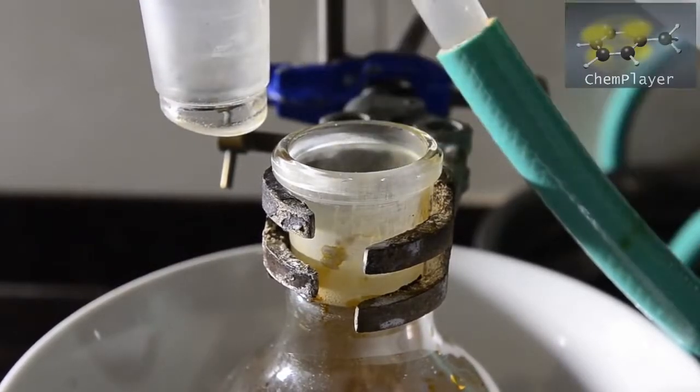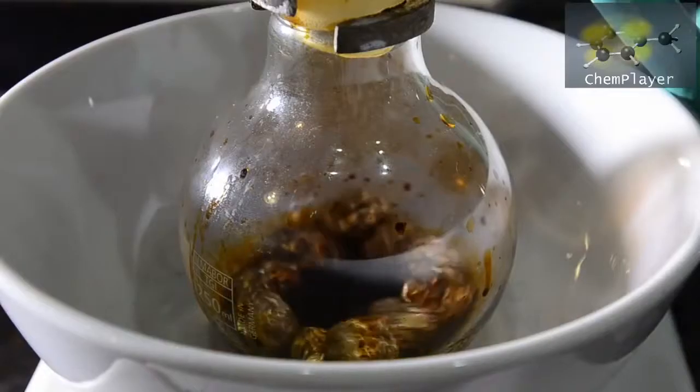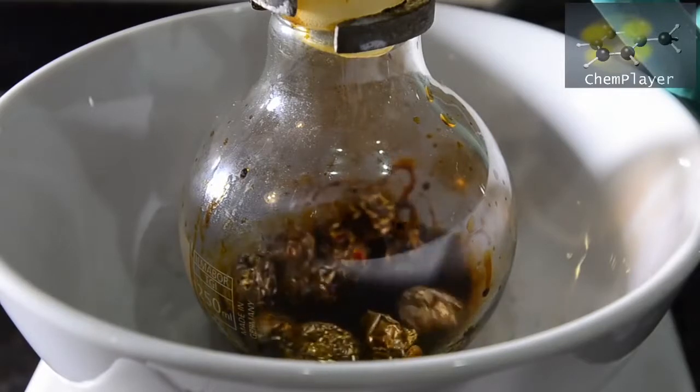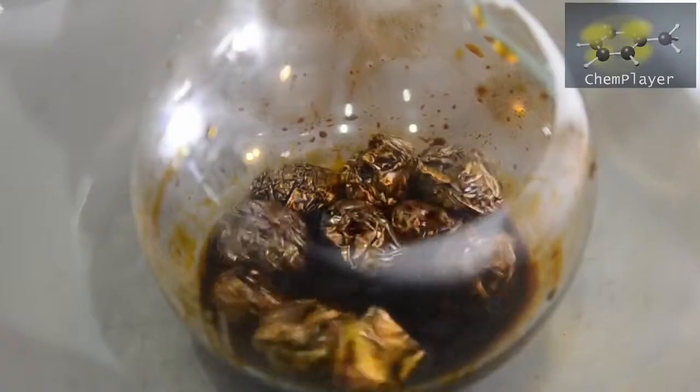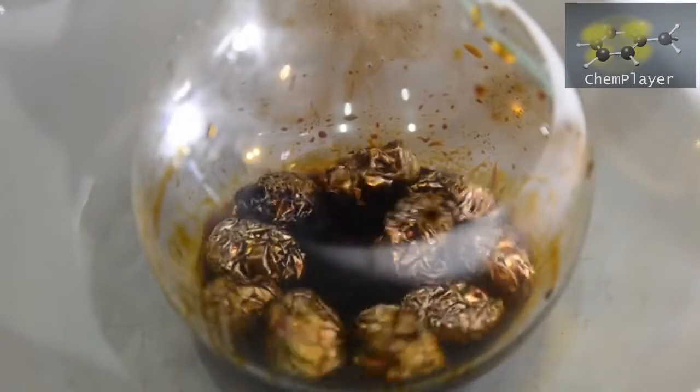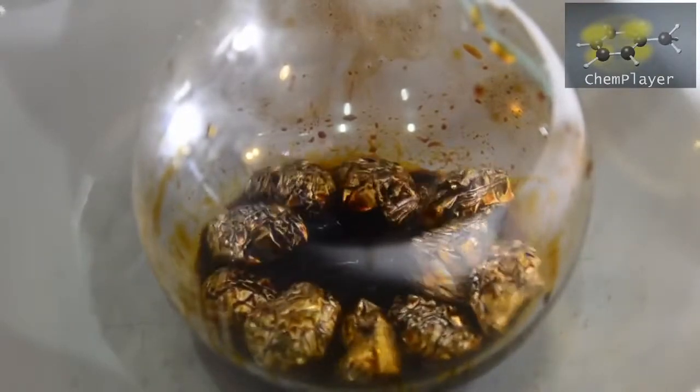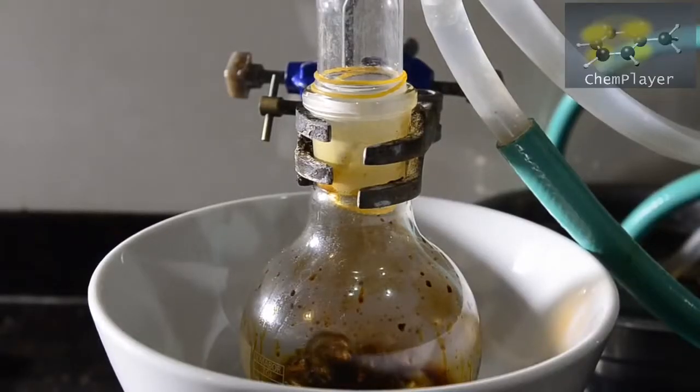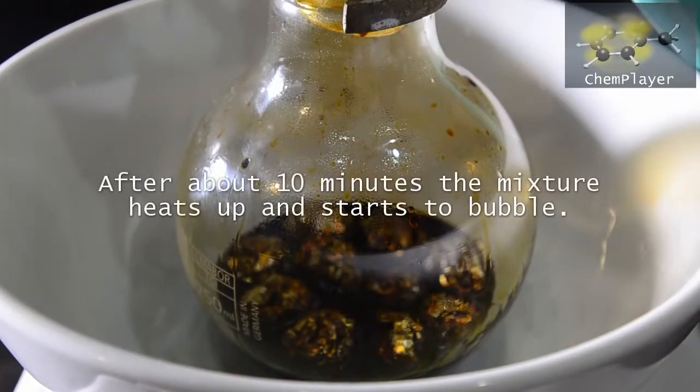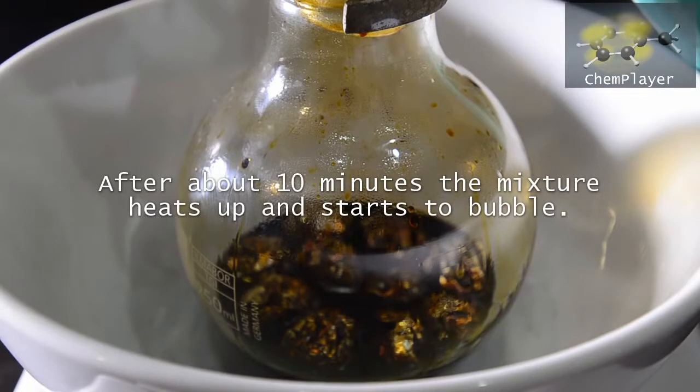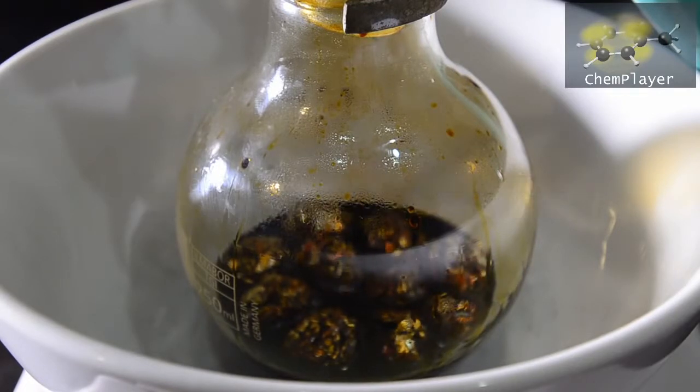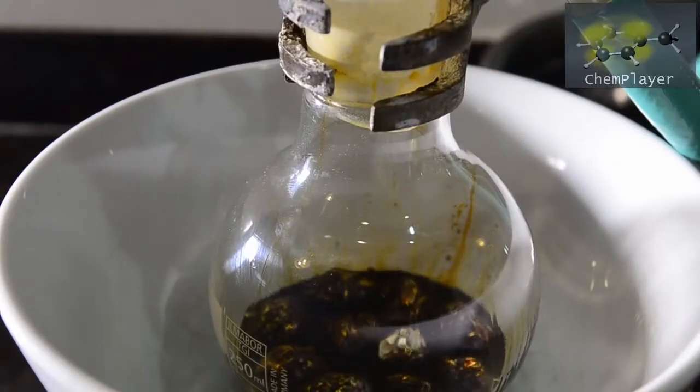We've got everything in there now and placed the condenser back on. There's no immediate fireworks, but we do notice that the mixture in the flask is warming up, and soon it starts to bubble. We start to get a reflux going in the flask as the temperature rises.